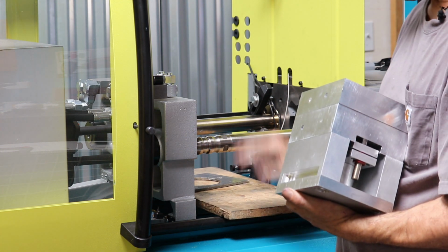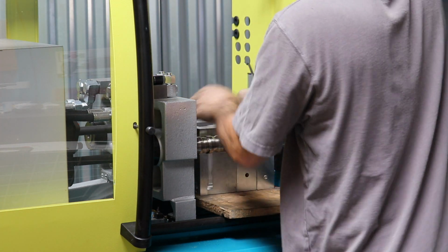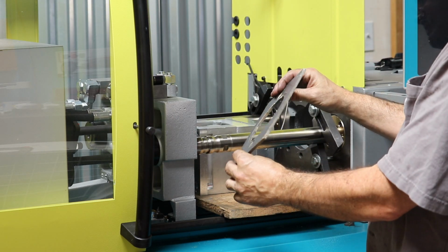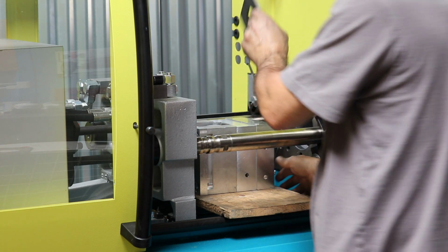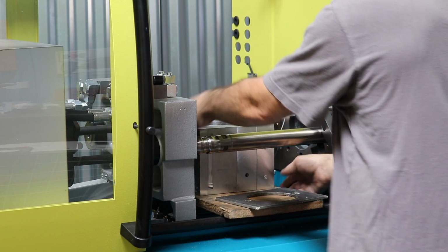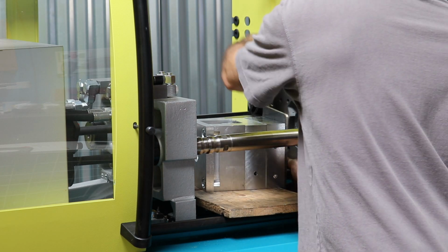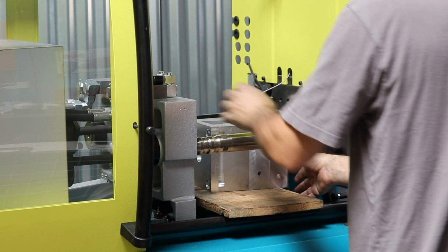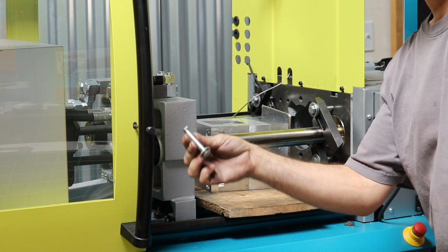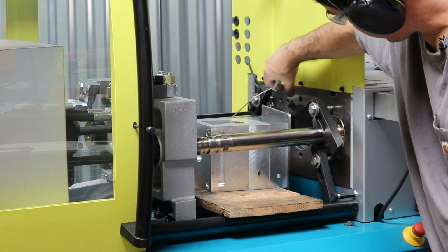I stick this wooden board across there to help support the mold while I'm loading it so it doesn't fall out onto the floor. And then we've got the temperature isolator plate, which is compacted fiberglass mostly. Make sure you can see. Yeah, you can see. So I'm going to string this isolator plate onto the front of the mold, like so. There's not a whole lot of room for alignment, and then I've got these 3/8 bolts that I string through the A-platen side of the molding machine right here.